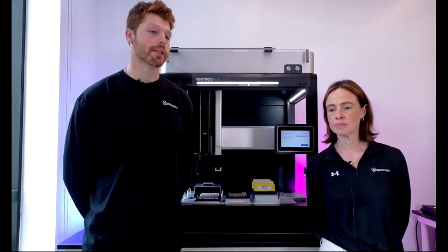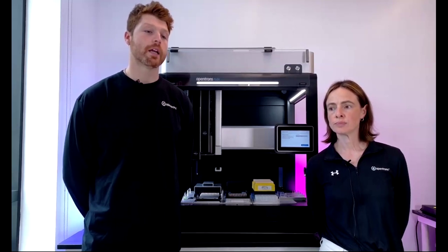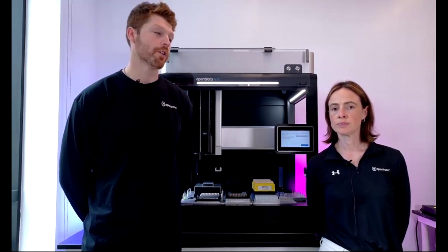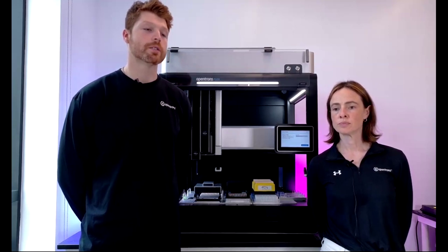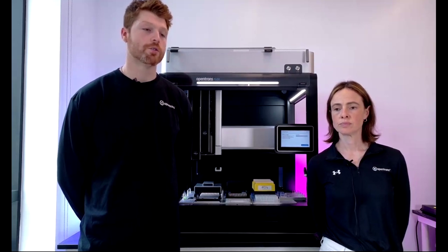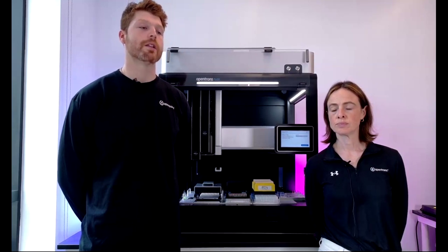Great. All right, Flavio asks again, can the gripper open or close plastic bottles or crimp vials? So currently, no. It is designed singularly for SBS format labwares. And we don't have a configuration that would do those specific motions that you're asking for in terms of opening up tubes or vials or things along those lines. It's really designed to move labwares.